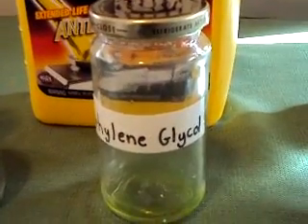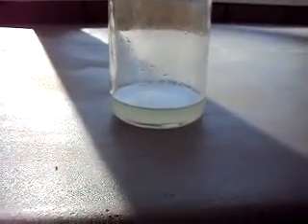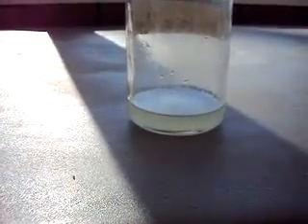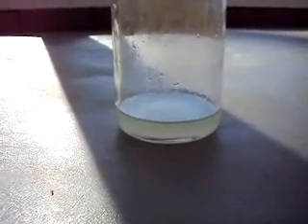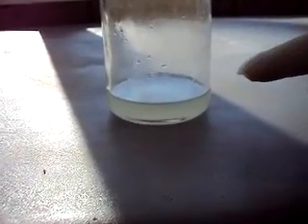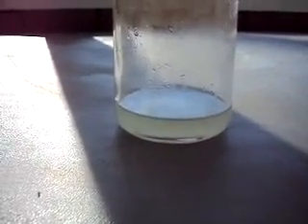I'm going to go ahead and put these chemicals together, take it outside, and start the reaction. Okay, we're back outside now. I have the solution of the 35% hydrogen peroxide, the 70% nitric acid, and the ethylene glycol. What I've noticed is when adding all the ingredients — namely the nitric — to the other two components, it became a cloudy solution.